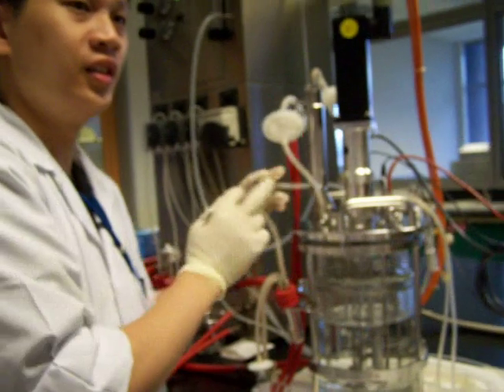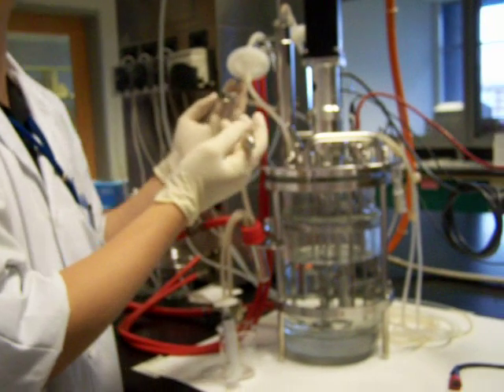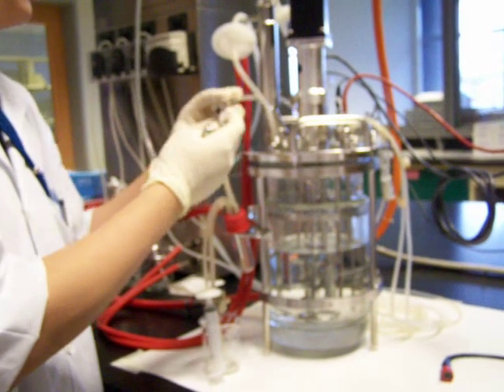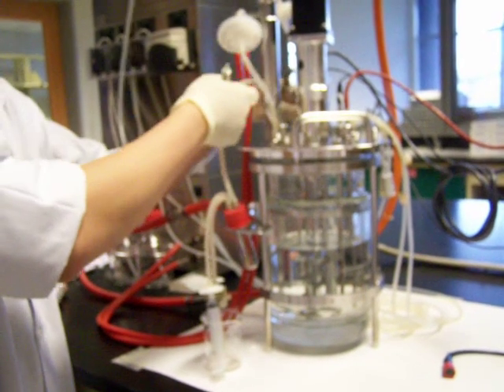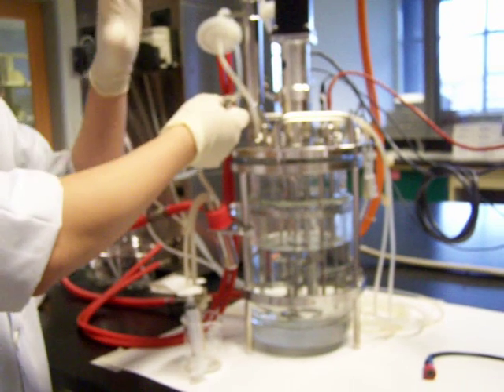So essentially, this is the two couplings. When it's autoclaved, you can see from the other side it's detached. There's a cover for it. This coupling point is leading to a sampling tube, just a stainless steel tube that's hollow.